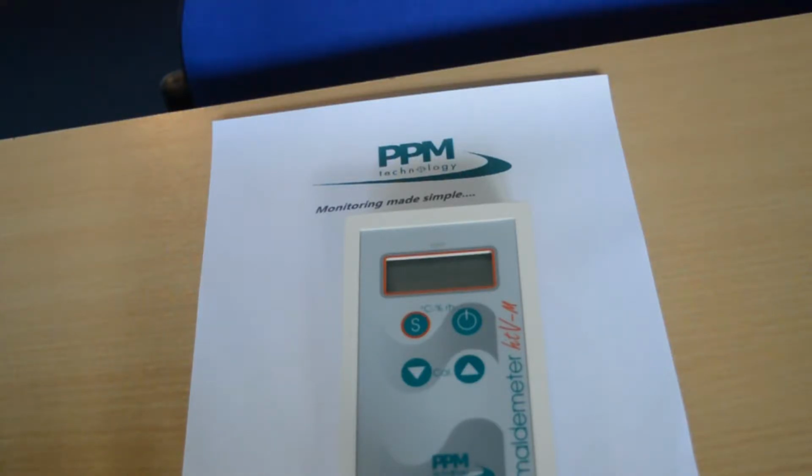Limit 4, used in extended range for formaldemeter. Please contact the manufacturer regarding this setting, as changing to Limit 4 may require additional changes to the instrument settings and hardware.